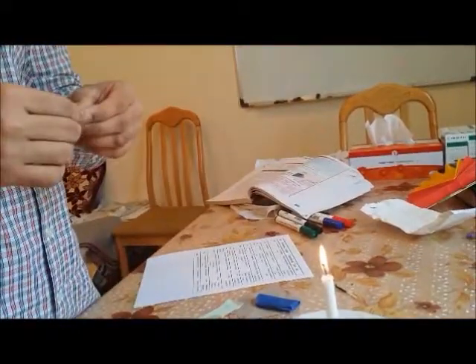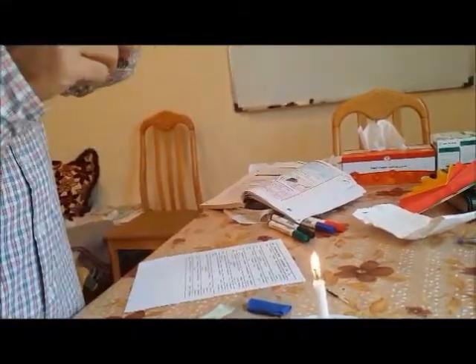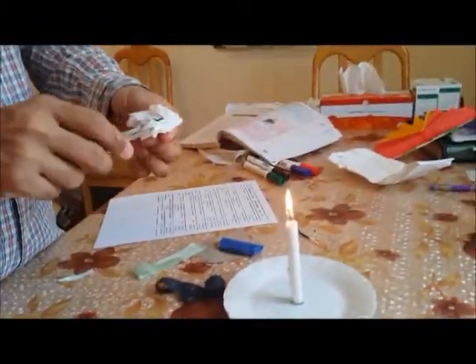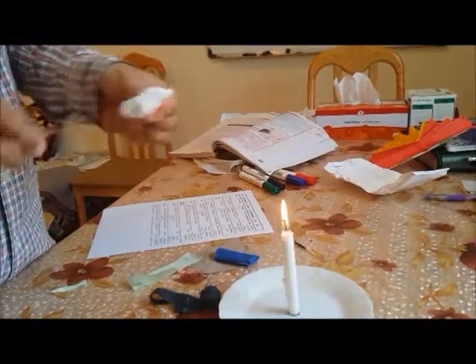From this green color, I will pull out my yarn. Don't forget to wipe out any residue from your forceps.